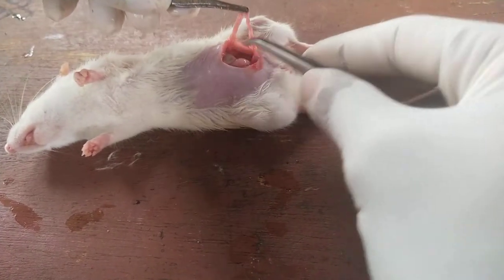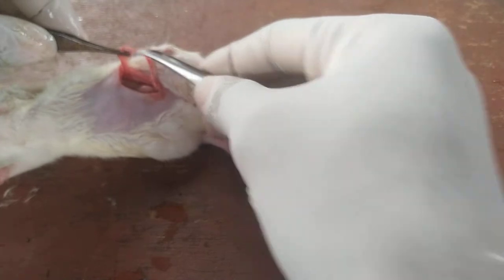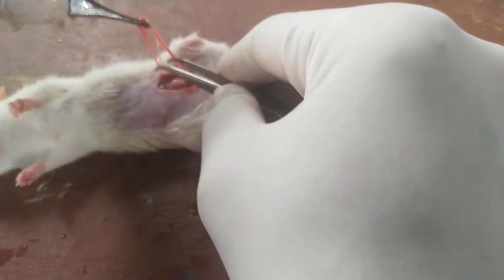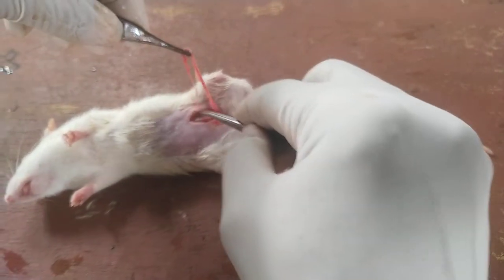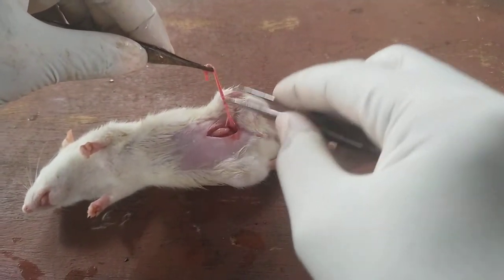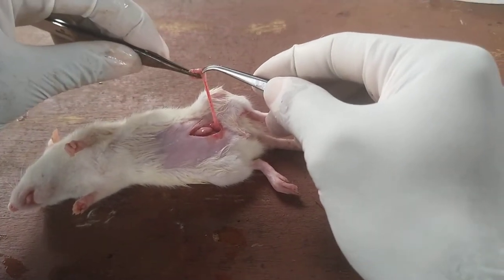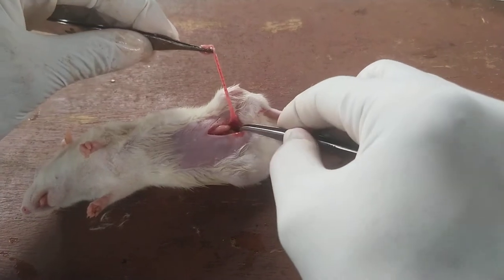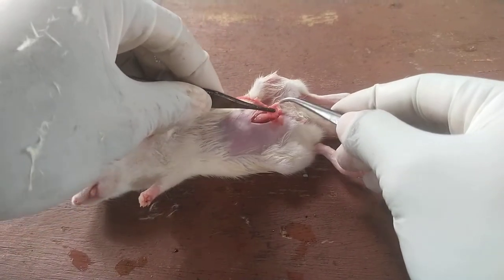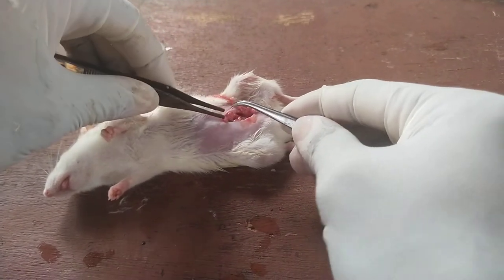This is the uterine tube — the left uterine tube — and this is the ovary, so I take it out. Severing the fat: holding the left uterine tube together with the fallopian tube and the ovaries. The ovaries are embedded in fat. Now I can locate the other side — the right side.